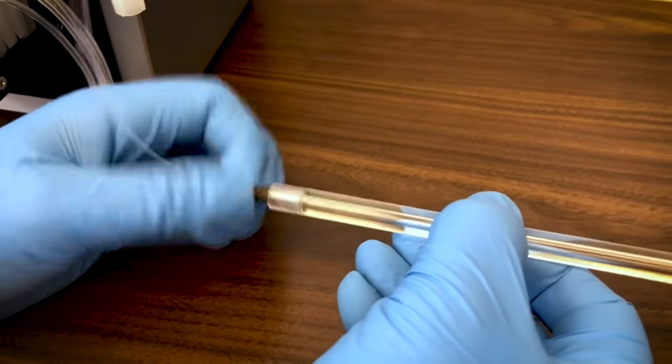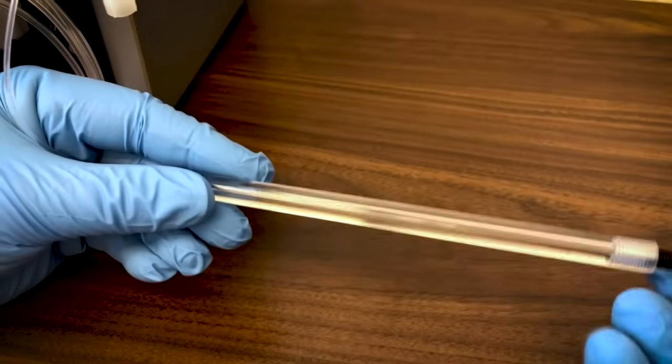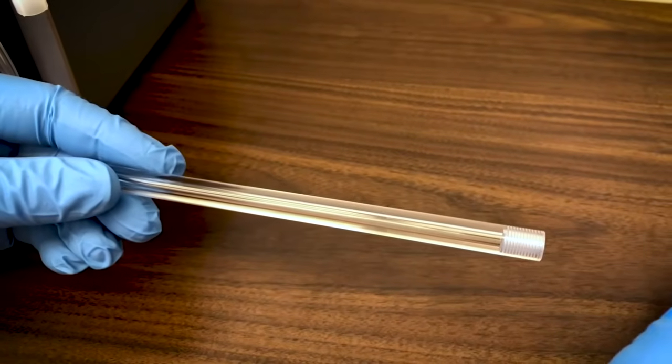Once the bottom of the column is connected, remove the plug from the top of the column and screw the tubing into this as well. Put the column back into the clips.